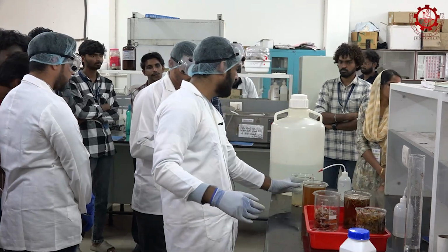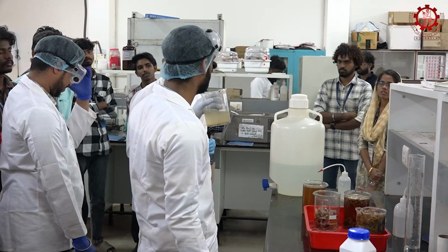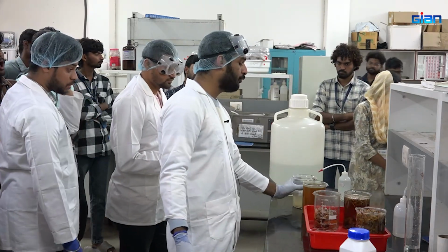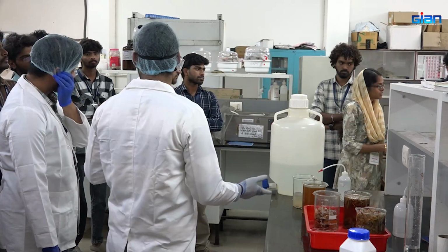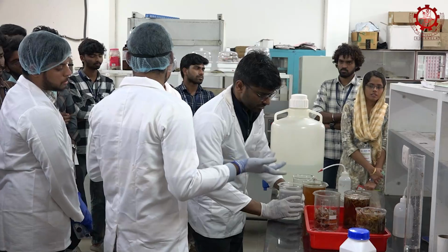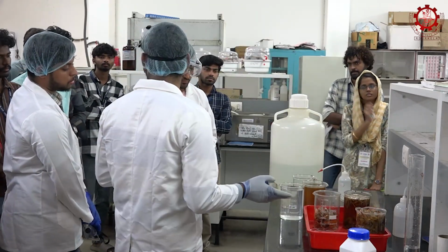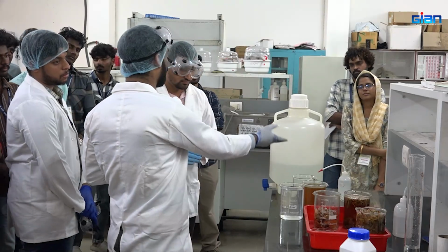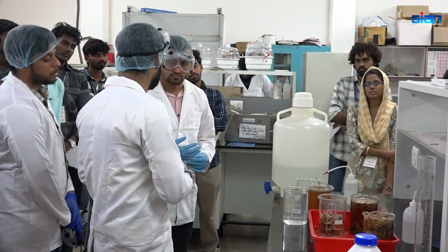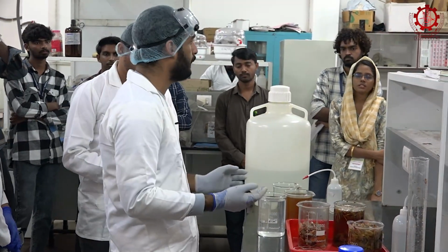So if the water color is somewhat different, it may also contain some water soluble protein fraction, a small amount. Or even, since we have kept it in a high concentration of HCl, definitely some of the protein is denatured. So a denatured fraction might also be there, like some peptides. If you are taking the peptides and going for some antimicrobial studies, they may show better antimicrobial properties. So that can also be done.